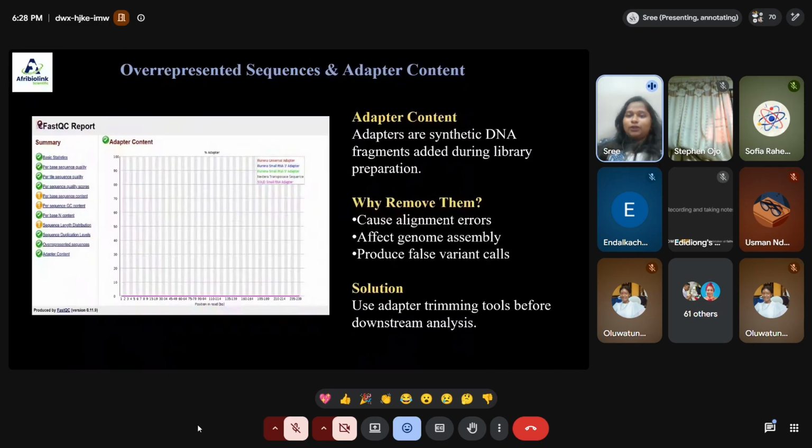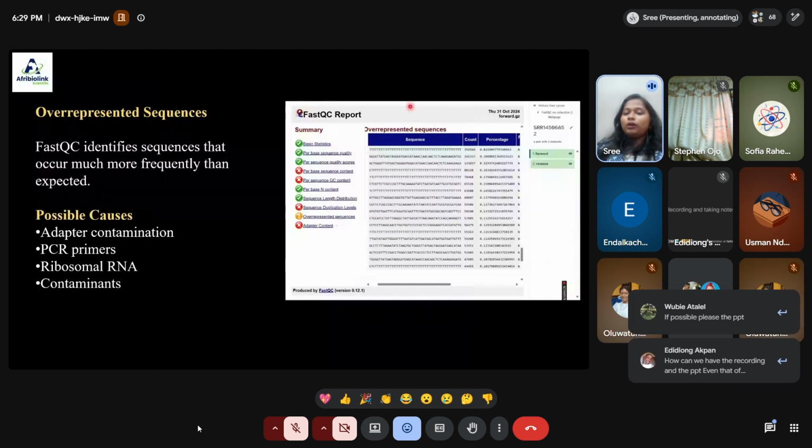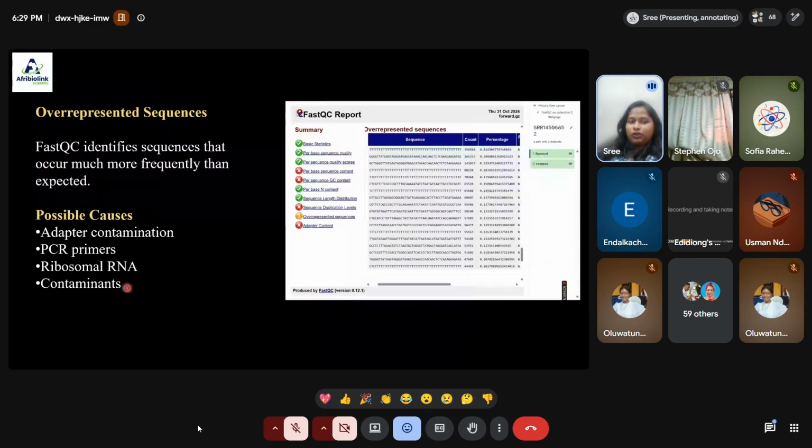Overrepresentation and adapter contamination. Adapter contamination is based upon the synthetic DNA fragments added during the library preparation process. If the sample has overrepresented content or adapter contamination, we need to remove it during a trimming process, and then we need to do a filtering process. That's why adapter trimming is important before going into downstream analysis. That is what I have mentioned over here. You can see in the graph the overrepresentation of these sequences, which is due to adapter contamination, PCR primers, or ribosomal RNA, or a contaminating agent. All this leads to performing the trimming and filtering process. That's where the pre-processing comes in.